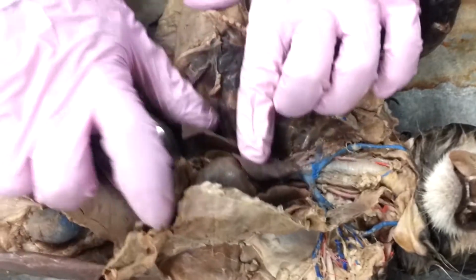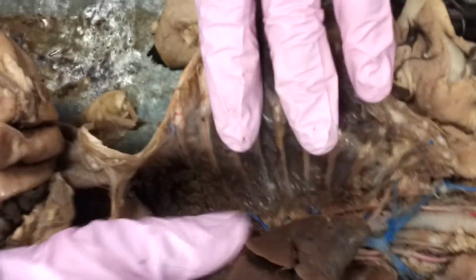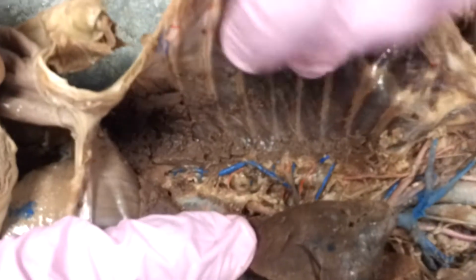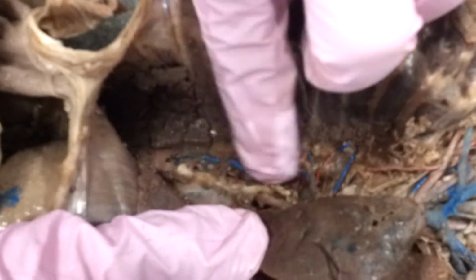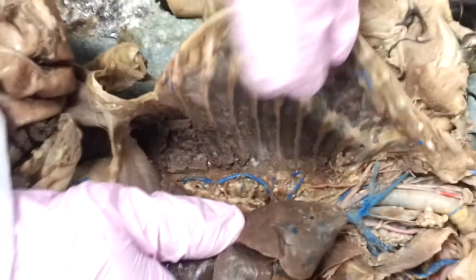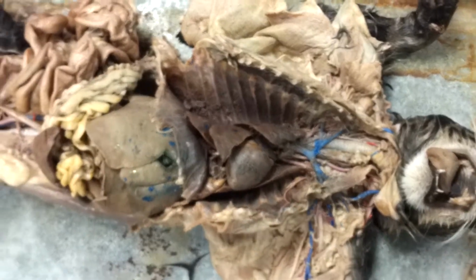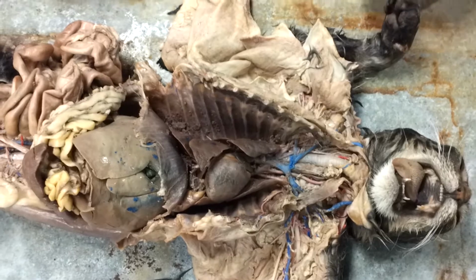The one thing, probably the hardest one that most people don't see, is the azygous vein. To find the azygous vein, we want to do a nice lung scoop on the right side. There's your azygous vein lying right there. Almost looks like it's on the other side of the aorta. What's that azygous vein going to do? Well, in case our inferior vena cava stops working, our azygous vein is going to take over.